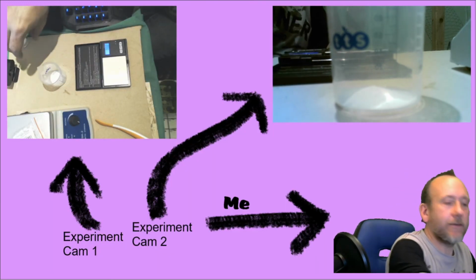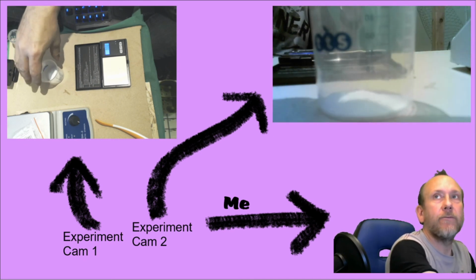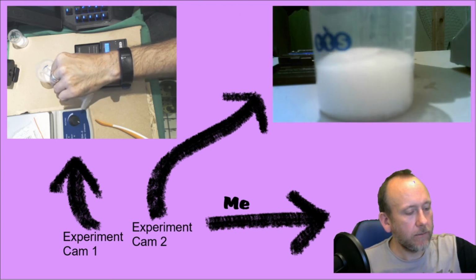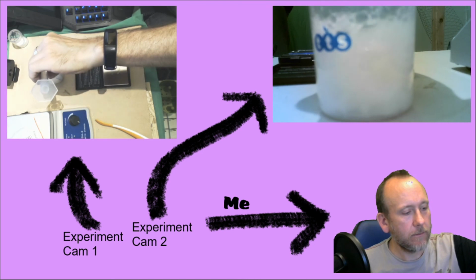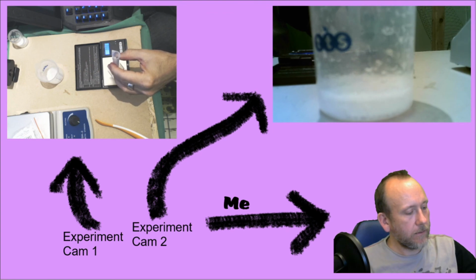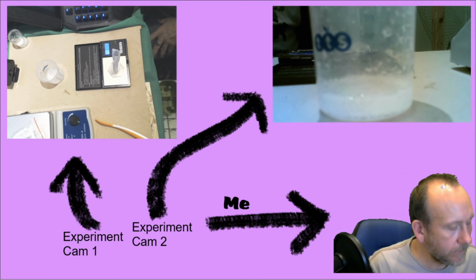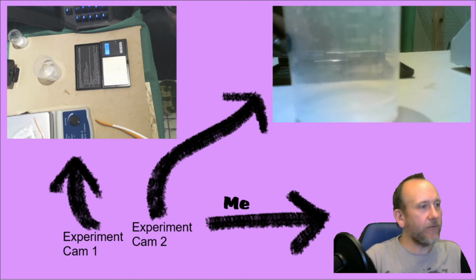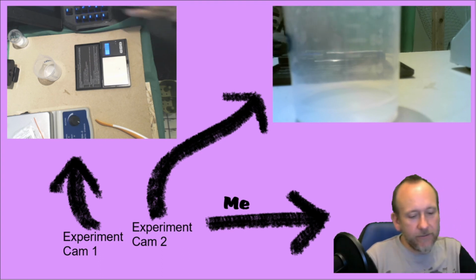I'm going to add the vinegar to my sodium hydrogen carbonate. And then I'm going to reweigh the measuring cylinder, and that's 8.74. The mass is similar as before. Okay, so the 3 experiments give us a mean of 5.14%.